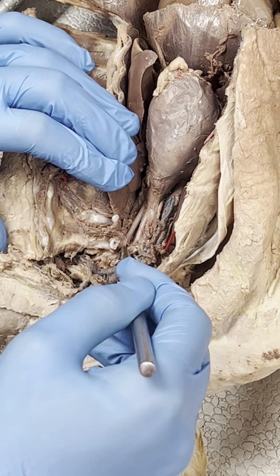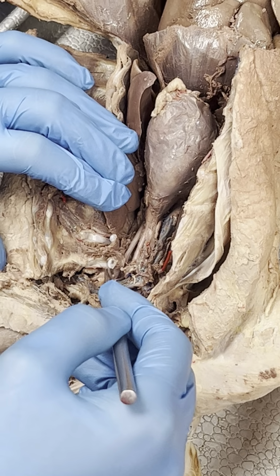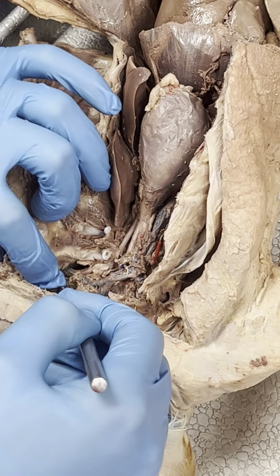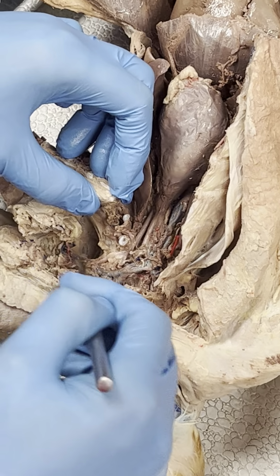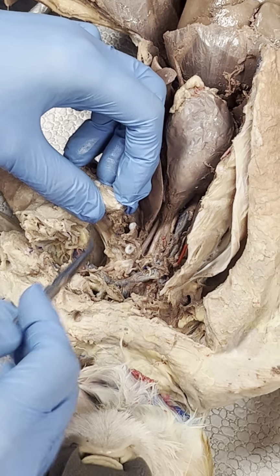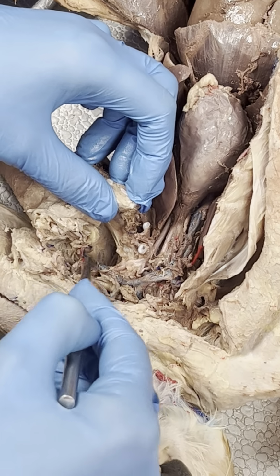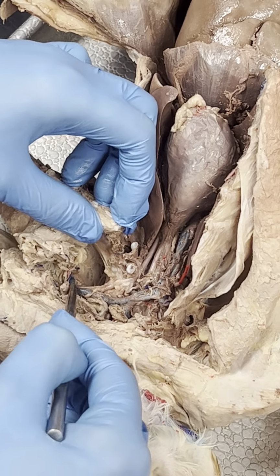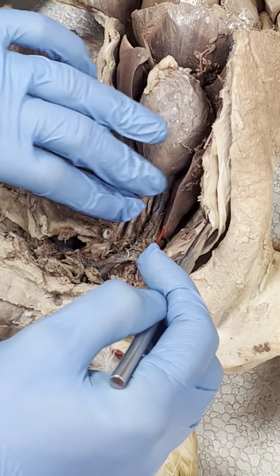you can see as soon as it passes out of the thoracic cavity, so here's the rib there, it becomes the axillary artery. And then following that, even deeper into the arm, once we pass this shoulder area, sorry, the vein is on top of it, it's going to become the brachial artery. Or brachial, not branchial, sorry. So that's the arterial system.